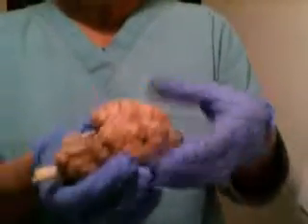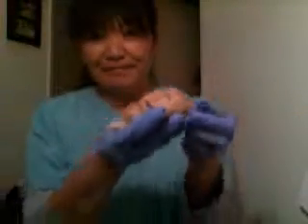Okay, so that's the dissection that I did at home for the sheep brain. Thank you.